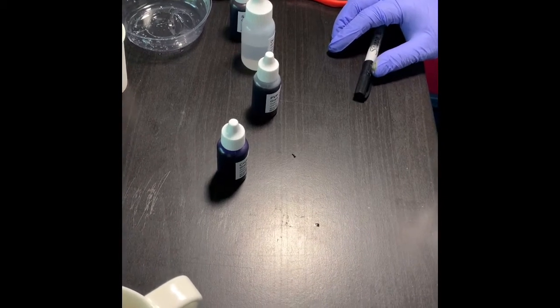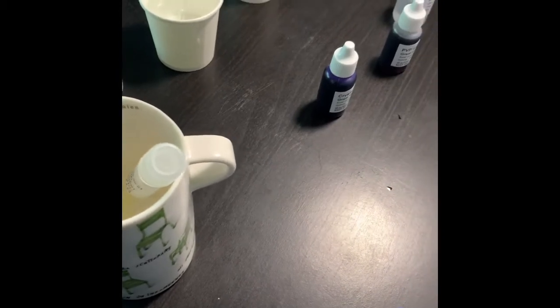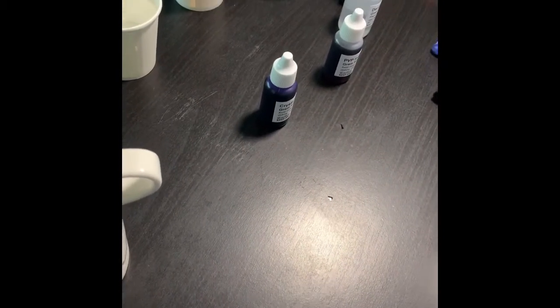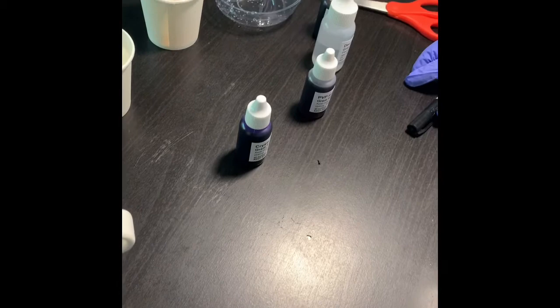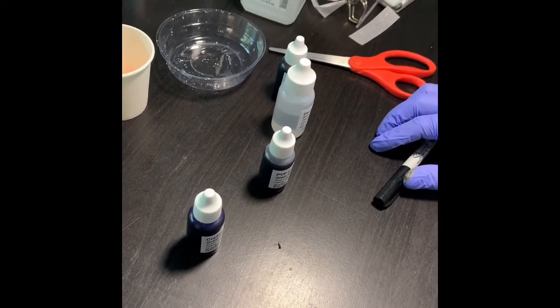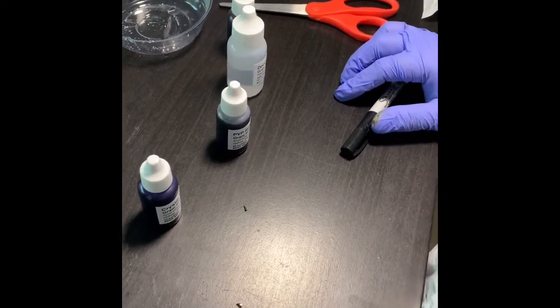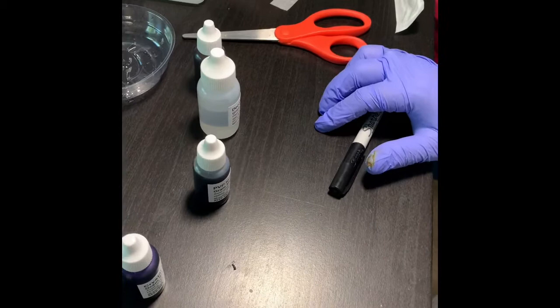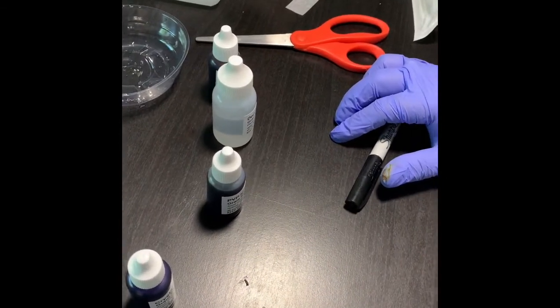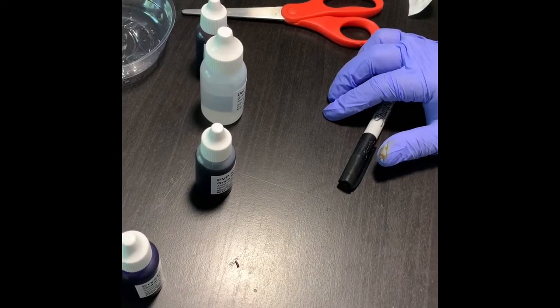Okay, so in today's lab, that is exercise 2 of lesson 5, I am going to show you the gram stain. So you all know that gram stain is a differential stain, as you have studied in your lecture, that differentiates two types of bacteria on the basis of the thickness of the peptidoglycan layer.